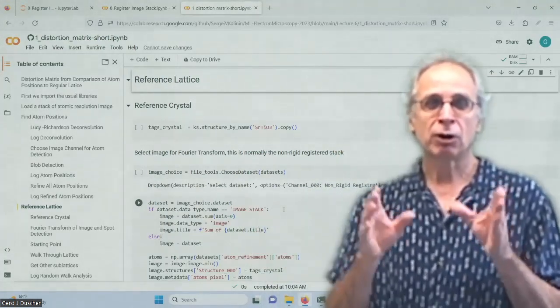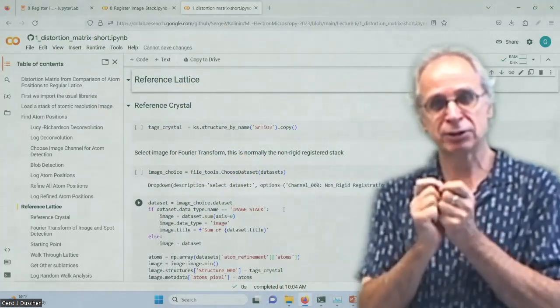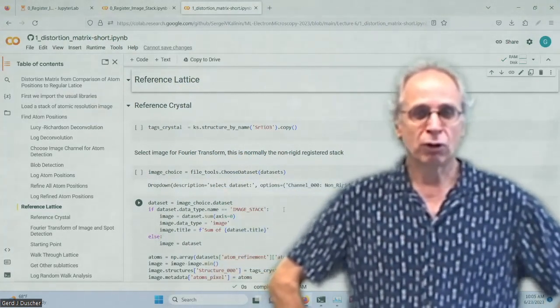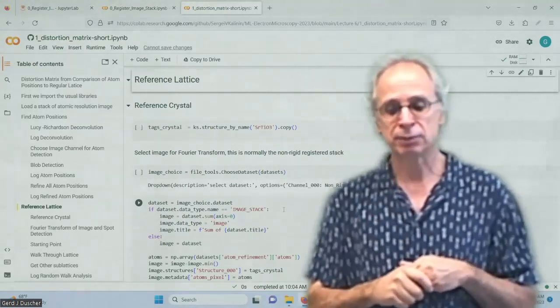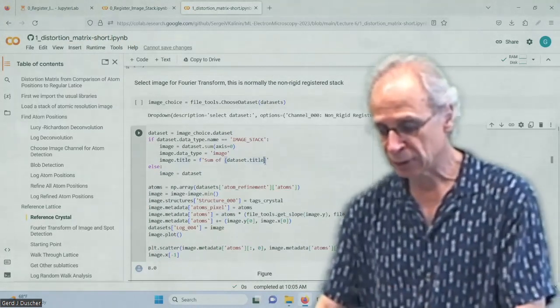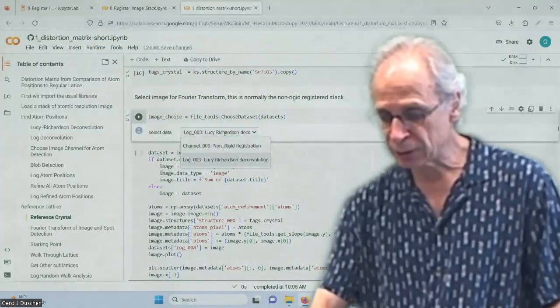Now we have to classify them. So what I want to do is jump through the atoms and look at them as a graph. Each atom is a vertex or a node of a graph, and the bonds are the edges of the graph, so the connections. Or I use only the unit cell, in which case the unit cell side is my edge of the graph. And for that, I need to know what kind of material it was, and I just load the strontium titanate from the kinematic diffraction package of pyTEMlib.